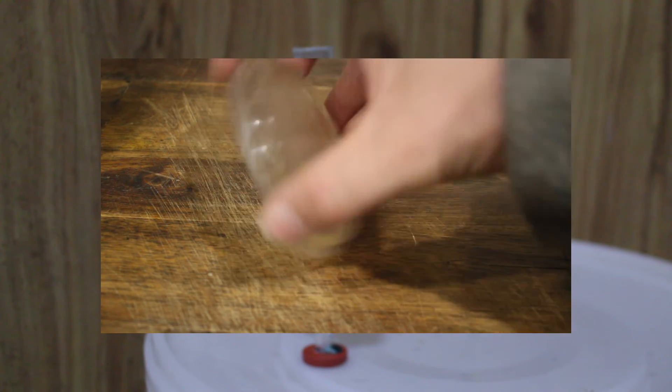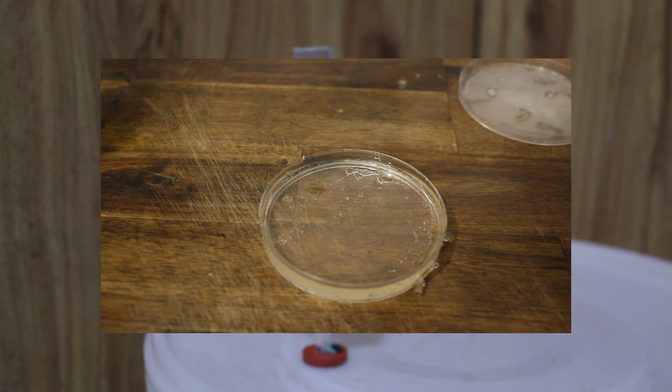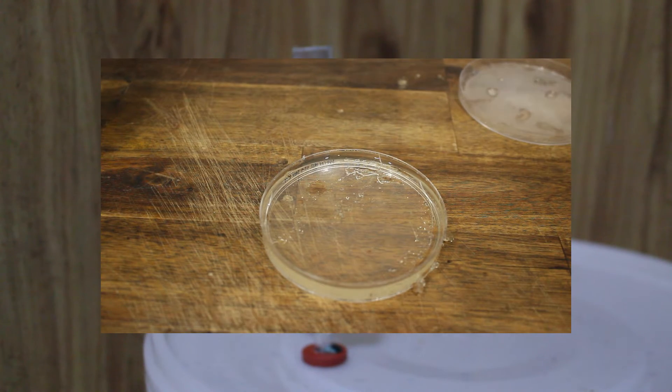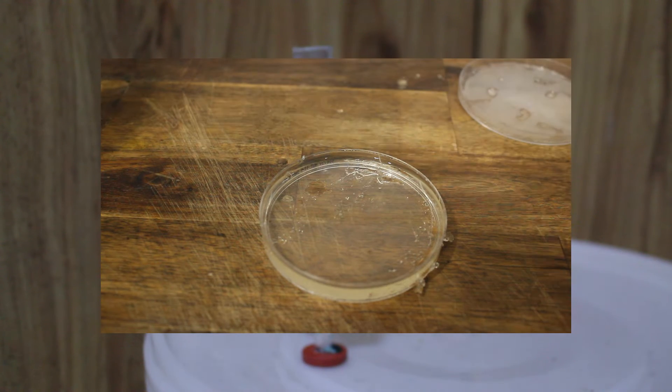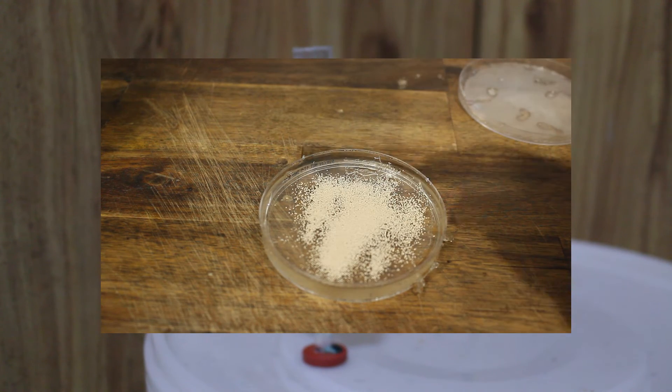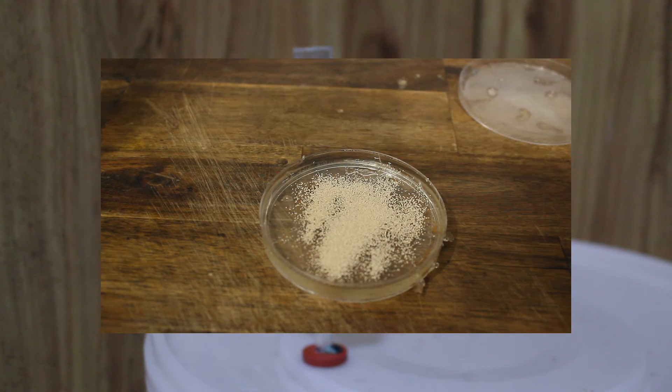First we have the wrong way. This is to take your sample of dried yeast for instance and literally pour it onto the plate. You will need to make a plate for this though, and every other method we're going to describe. We have gone with a very basic approach, a mixture of yeast nutrient, glucose, agar and water.